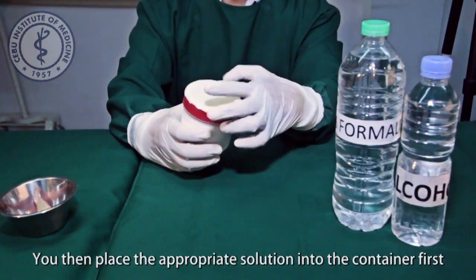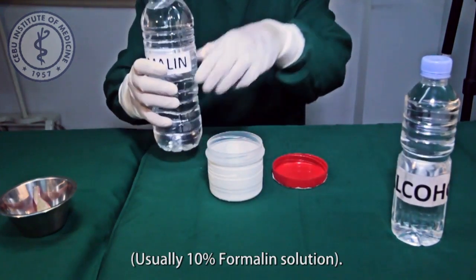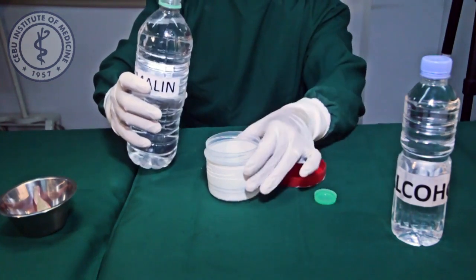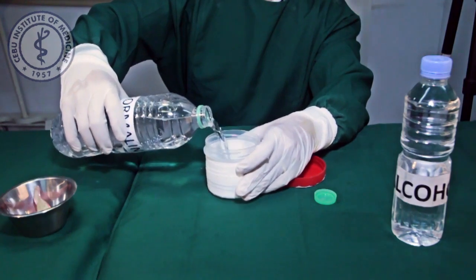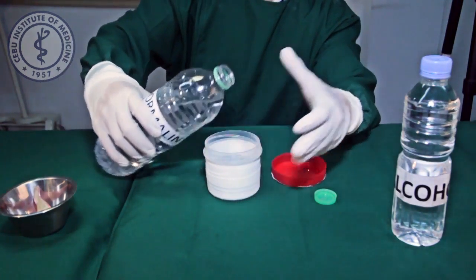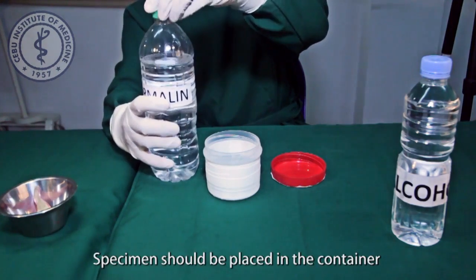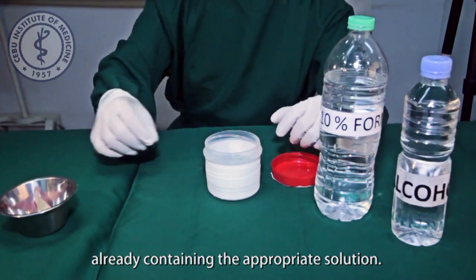You then place the appropriate solution into the container first. The specimen should be placed in the container already containing the appropriate solution.